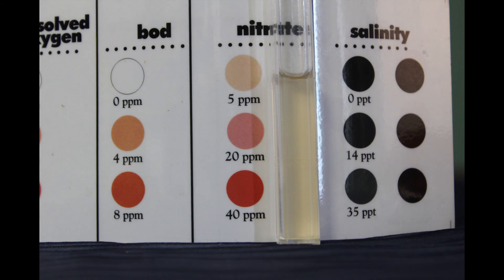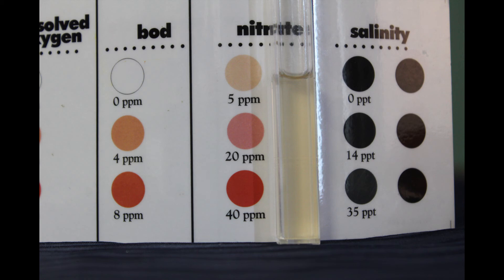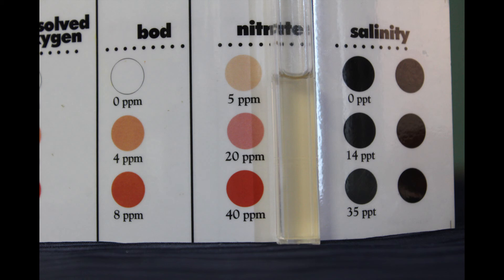Let's interpret the nitrate results. It's about five parts per million, which is an okay test result. Ideally, we would like to see less nitrate in the water. Since the sample was taken downtown next to streets, businesses, and the marina, I'm surprised it wasn't higher.